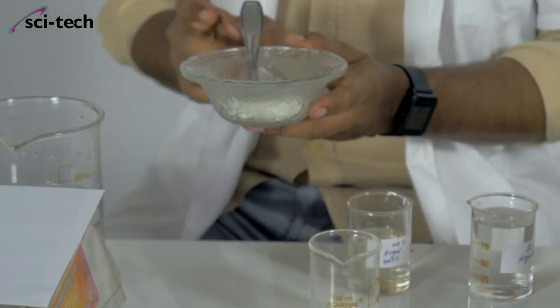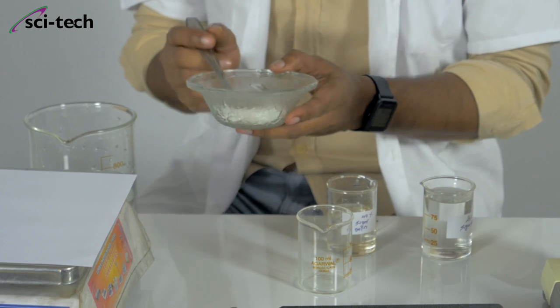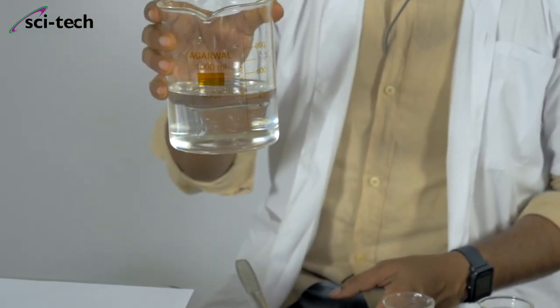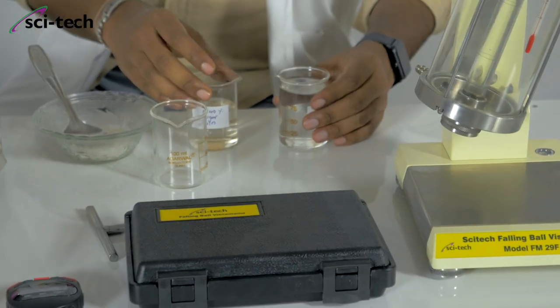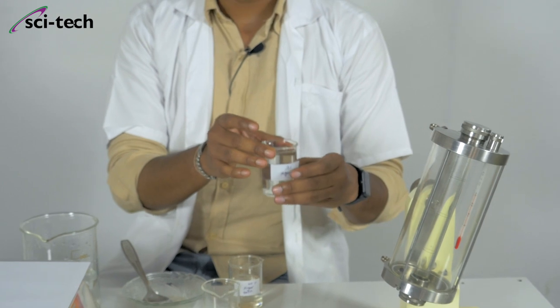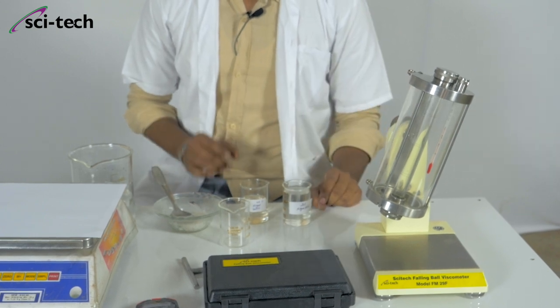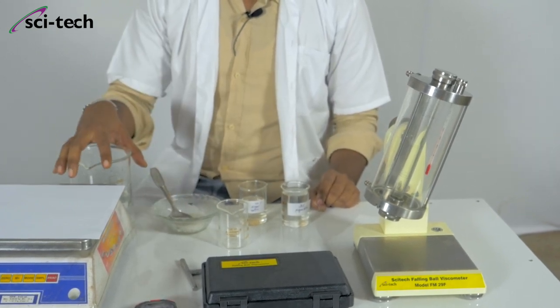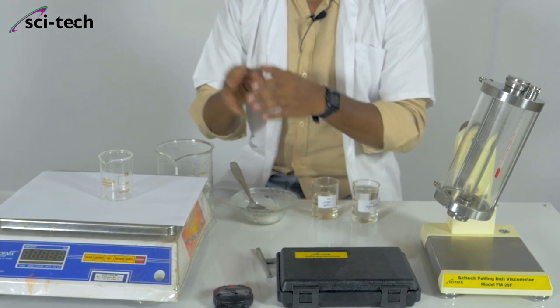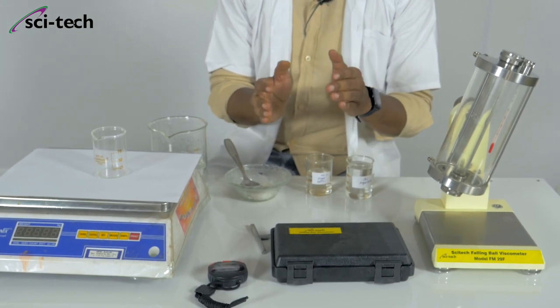I am using sugar as the solute and distilled water as the solvent. I have already prepared a 40% sugar solution and a 20% sugar solution, which I will use as the medium to pour inside the falling ball viscometer. With the weighing scale, we make the solution and record the data to first calculate the density of the solution.